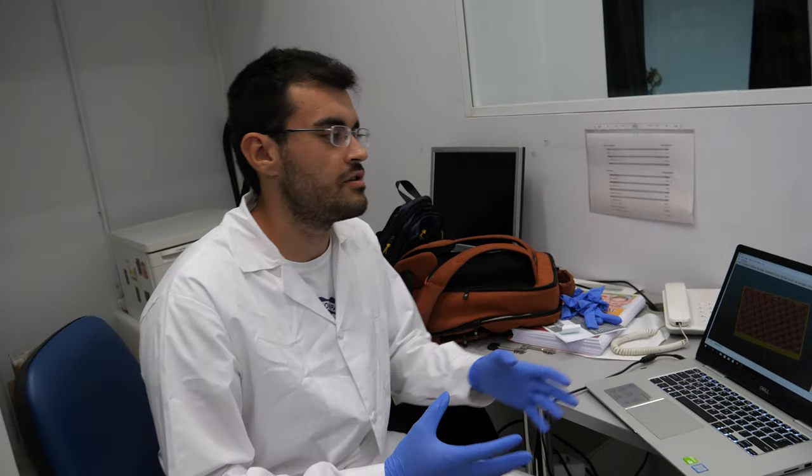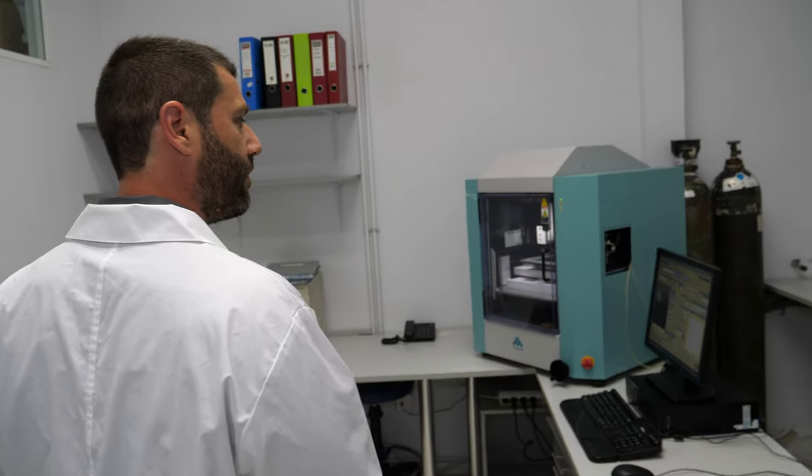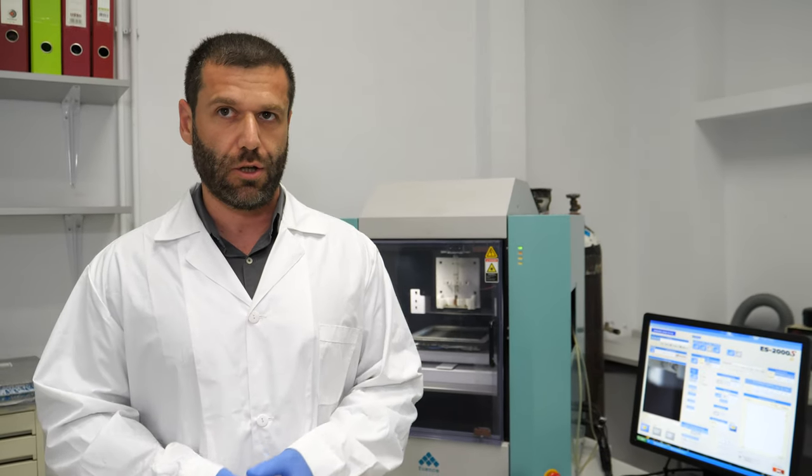Is it like a bioprinter — a special kind of printer? Yes. The procedure is the same for all kinds of printers. We're going to check that just after. So where are we right now in this room? We are where we produce our nanoparticles and nanofibers. This group deals with printed electronics, organic electronics, photovoltaics, and also coatings for biomedicine and nanobiomedicine. The main focus of the lab is nanotechnology — fabrication and characterization of nanostructures.